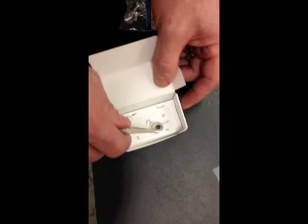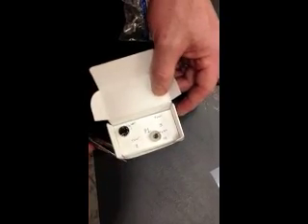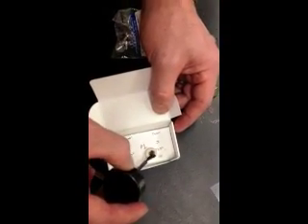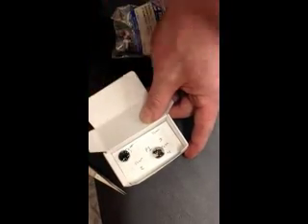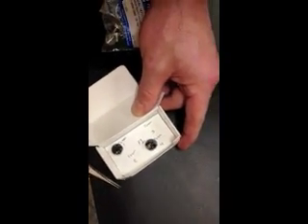Lightly, gently push down a little bit. And you might want to, just to verify, put some more around it — not getting it on the surface. Because remember you're scanning everything, and if you put it on the surface that you're going to scan, you're going to actually just see the graphite. And you're going to want to let it dry.